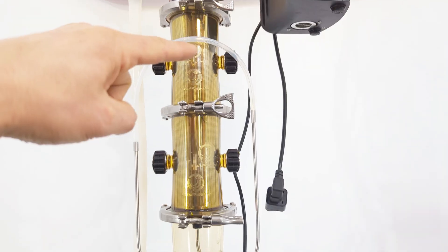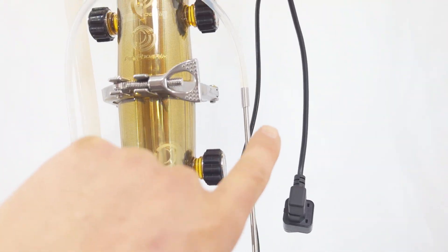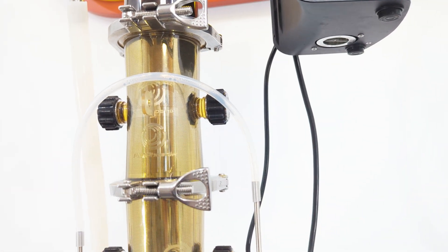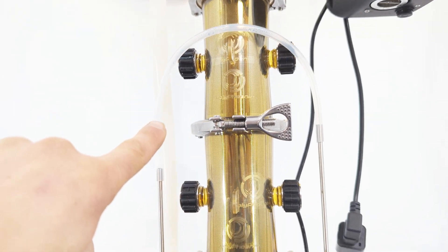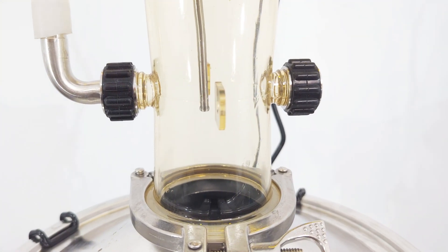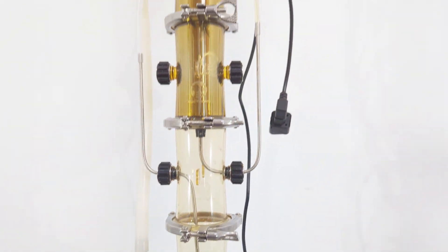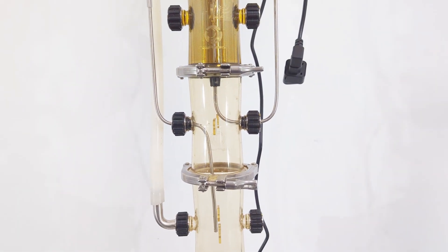The liquid is just about to hit the turning point now. What happens is the liquid gets past this point, starts the siphon, and then you'll see the liquid with the coffee in it starting to go down into the boiler. That is pretty much how this process works and what you need to do to build one of these yourself.